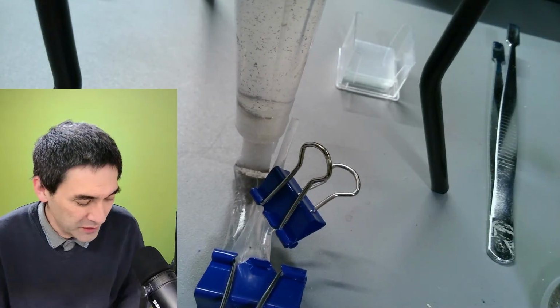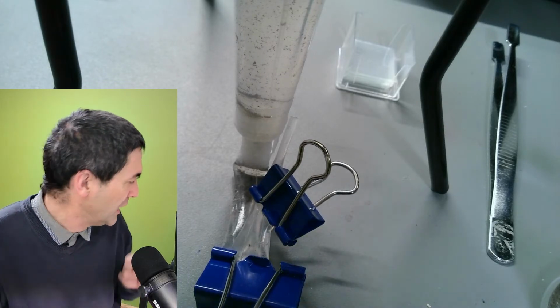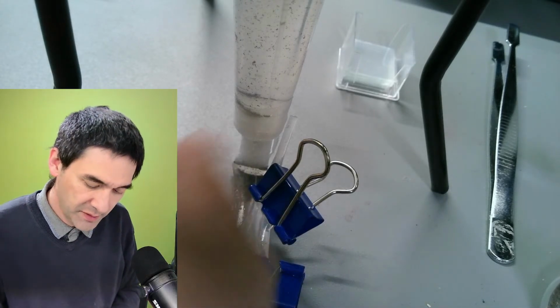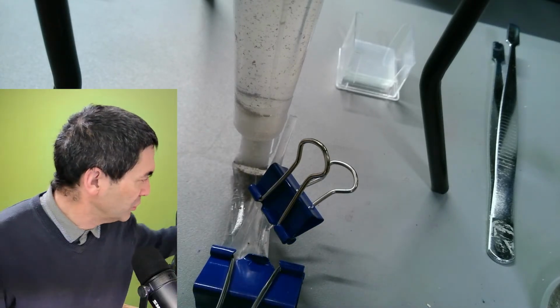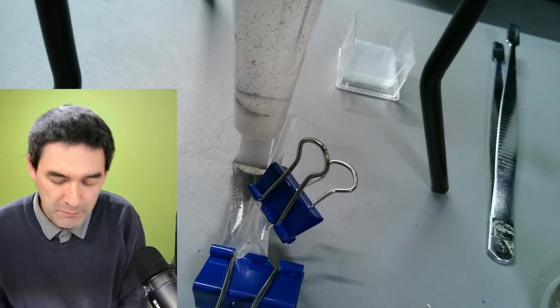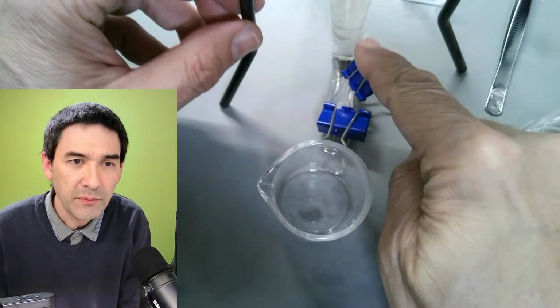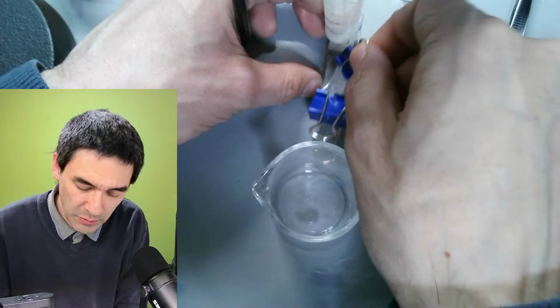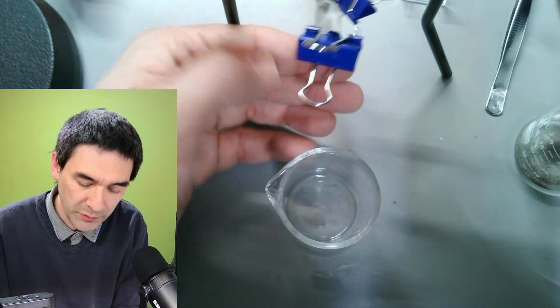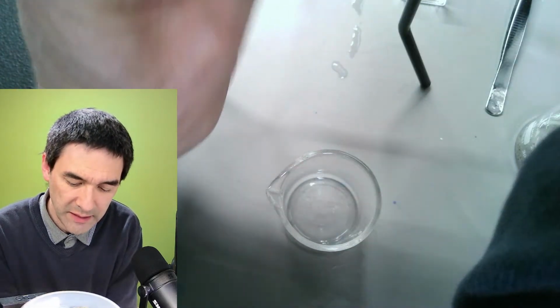So this is again not the best solution, but what I would like to do now is show you how you can collect some liquid from in here, and I'm going to do that by just a second. Here I've got a beaker, and now this is a little bit the problem with this setup, that there is not enough space here. So what I have to do is kind of lift this up here. Okay, I'm going to lift it out. I'm going to keep it closed. I need to lift it out.